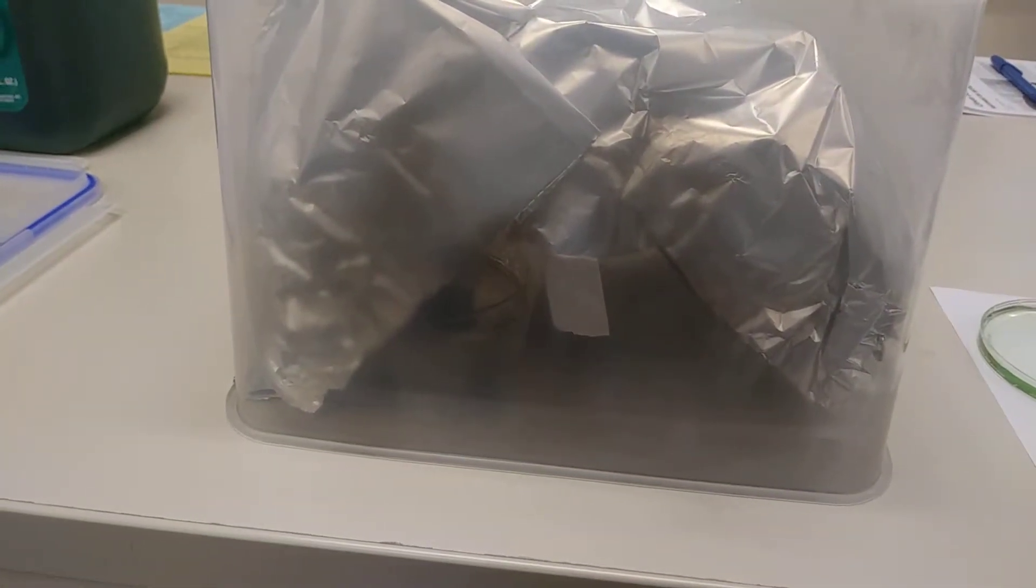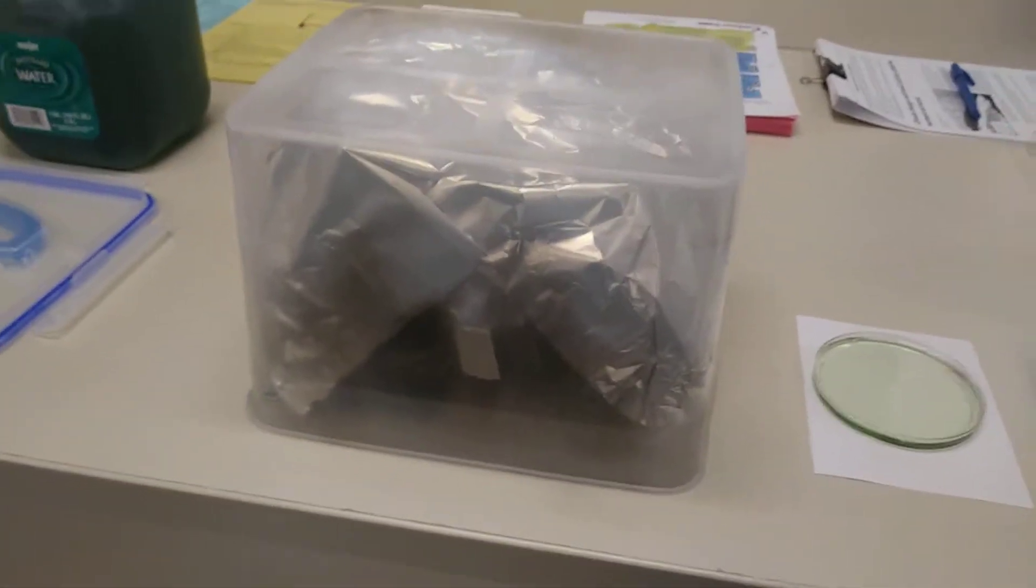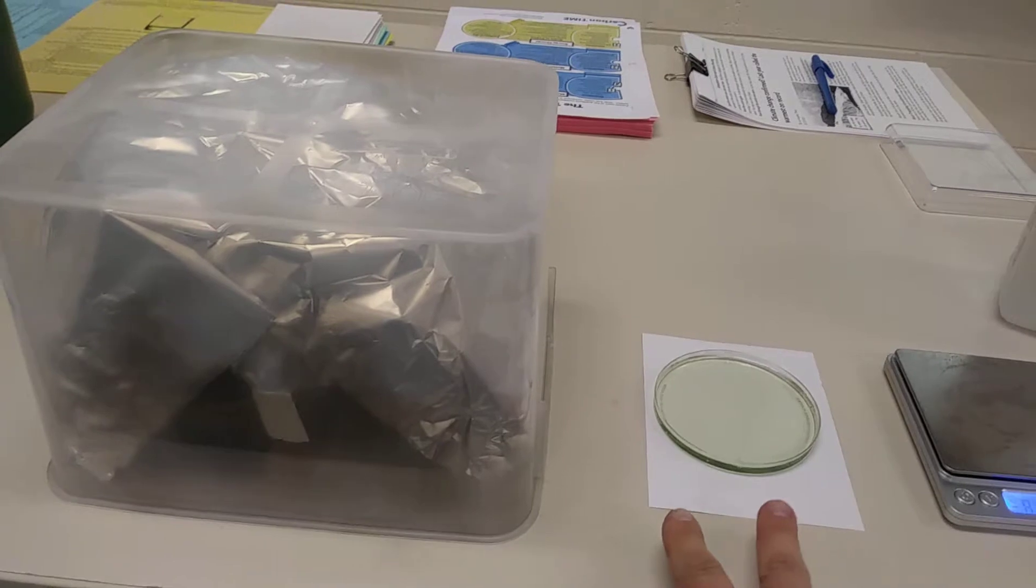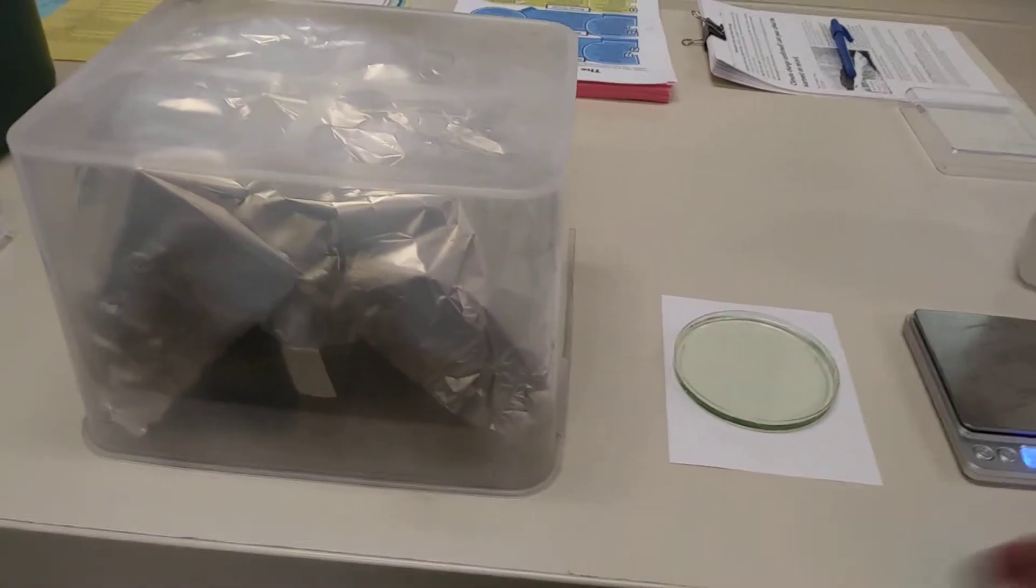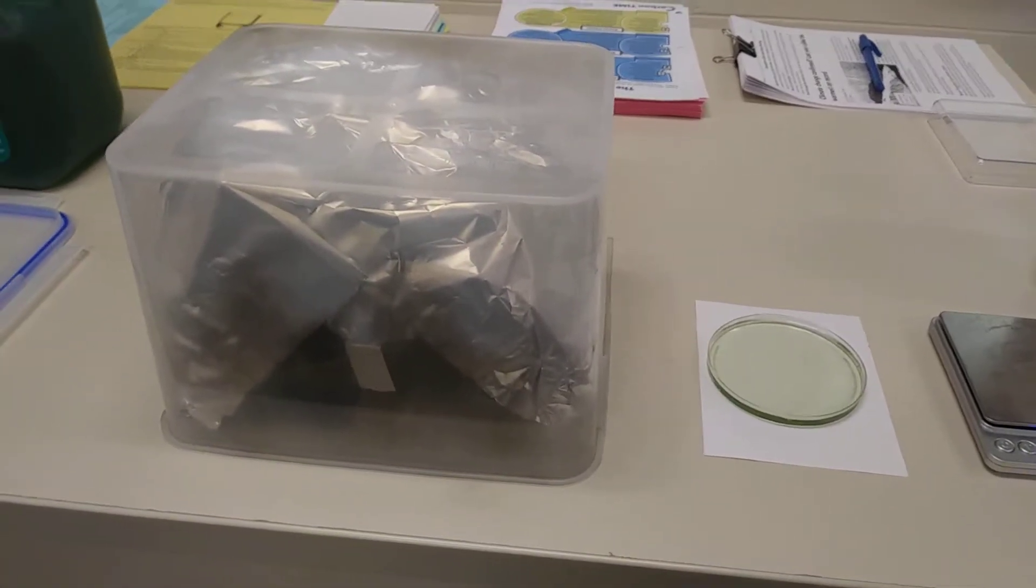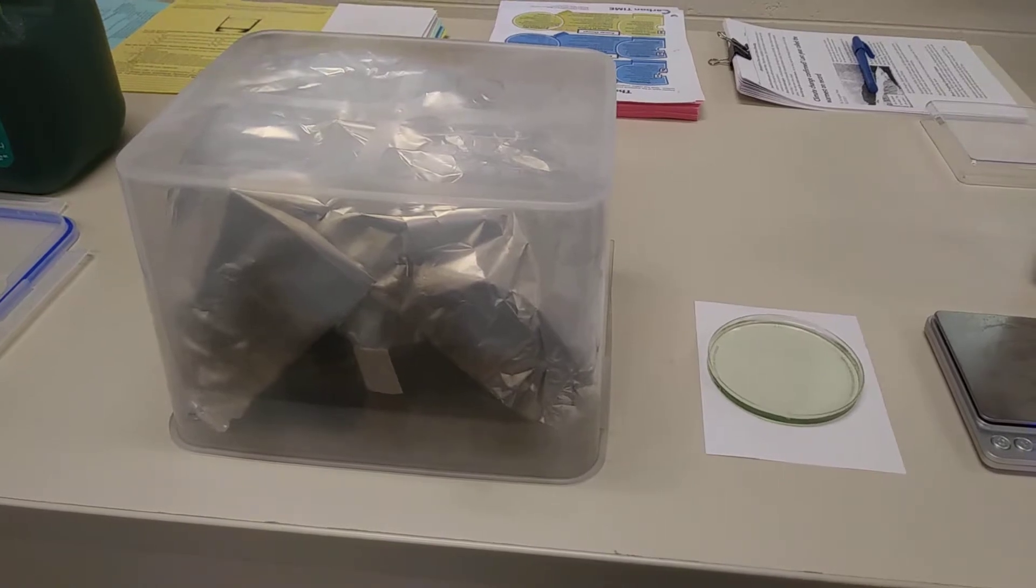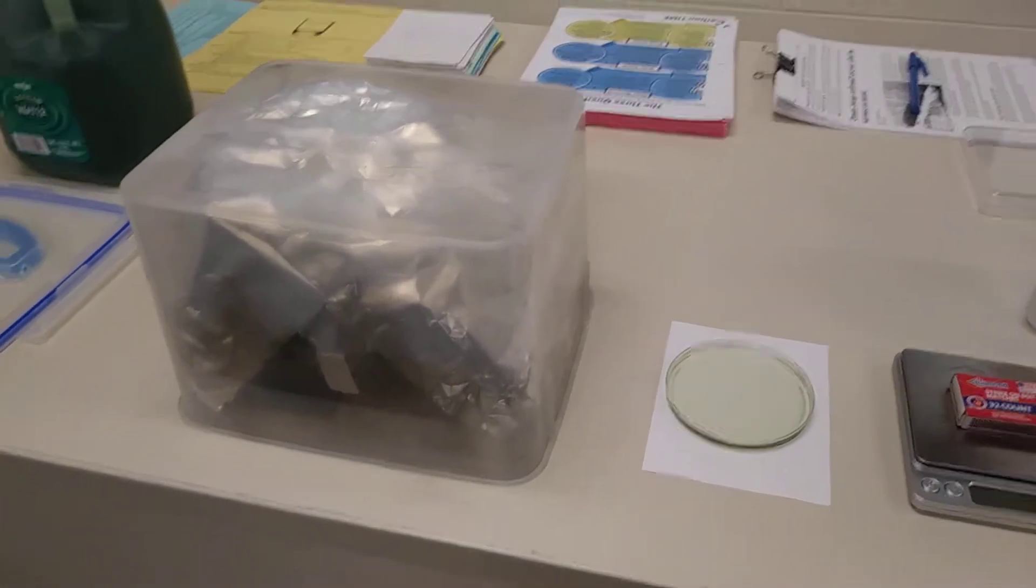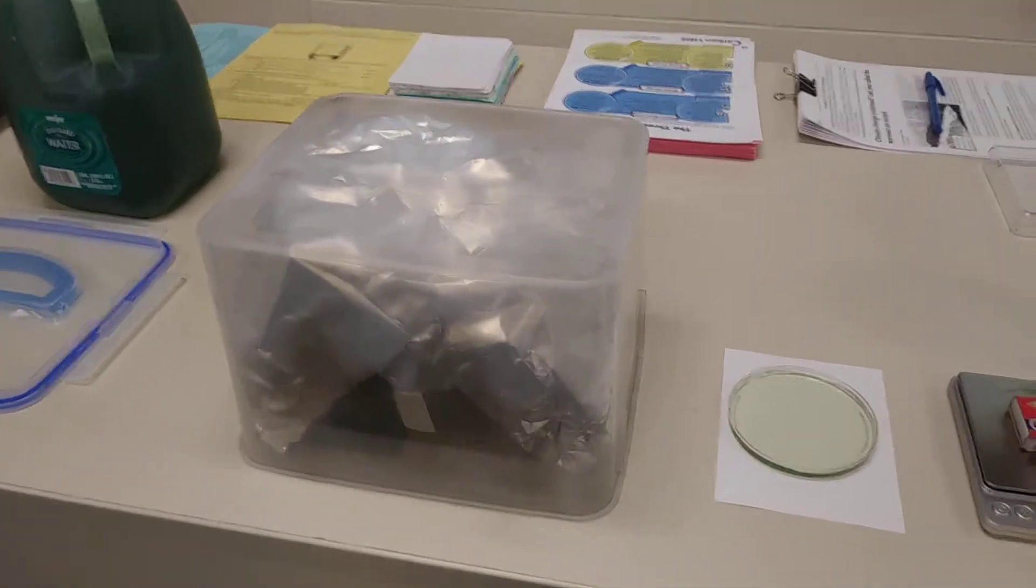I'm going to close that. You can see it still burns for a few seconds, and there it goes, so it went out. And I'm just going to leave this sit for a few minutes and see if there's any change. I have BTB outside just so that we can compare the new BTB to the old. We have let this sit here for about maybe 10 minutes or so.